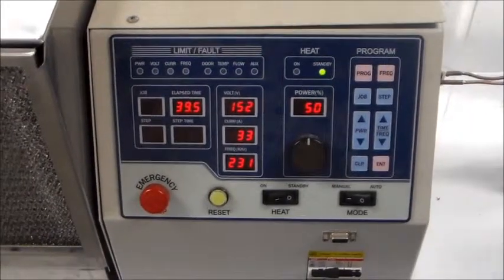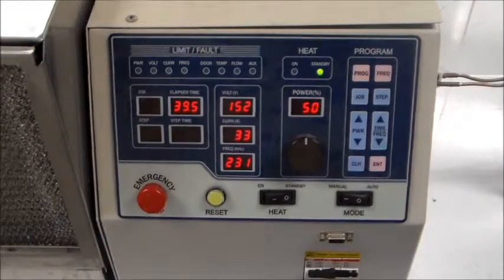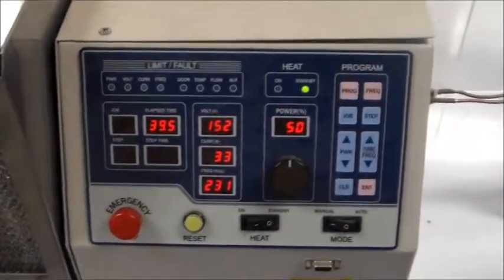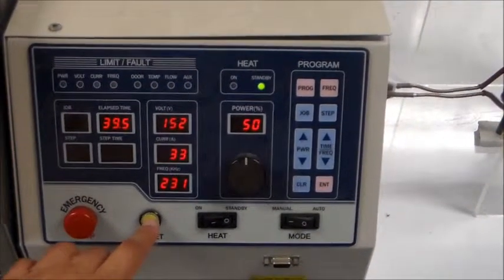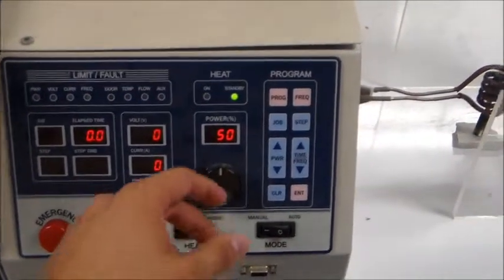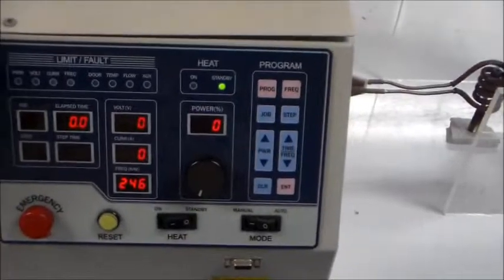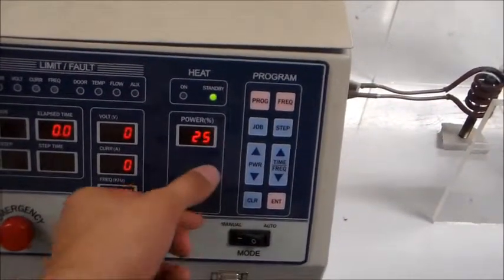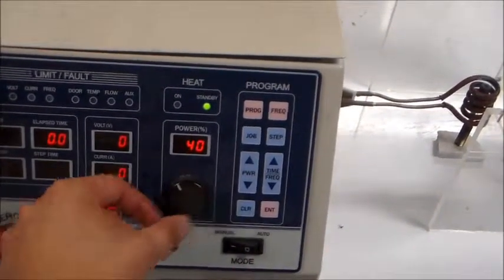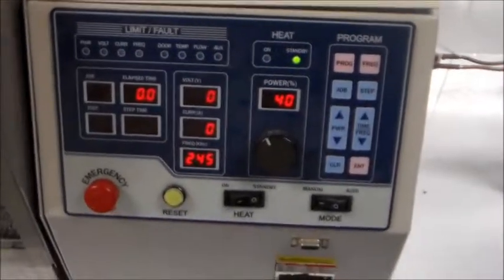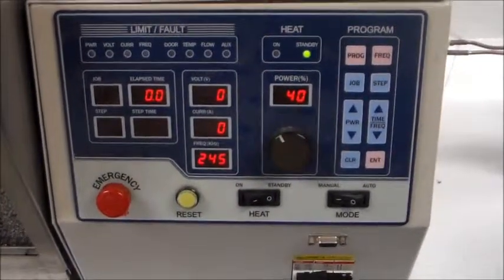If you want to reset a different power percentage, press the reset button, turn the power knob to zero position, reset the power percent to the desired amount, and follow the previously described procedure.